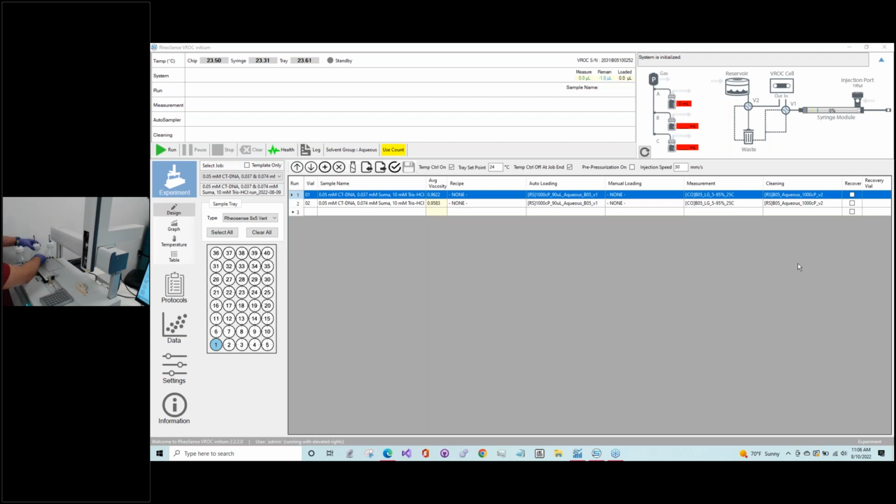And then you would take out the liquid one. And you can go ahead and replace your bottle. One thing I do want to note about these bottles is the caps do deform over time, this cap right here. So make sure when you're opening and closing it, you're not closing it like, I guess I would describe it like Superman. So you don't want to close it as tight as you physically can. I know that varies from person to person because these do deform over time, and then eventually you will have to replace them sooner if it doesn't tighten as well.